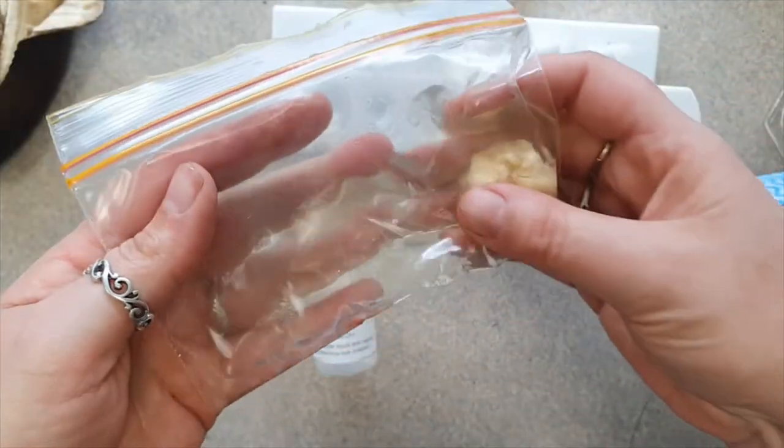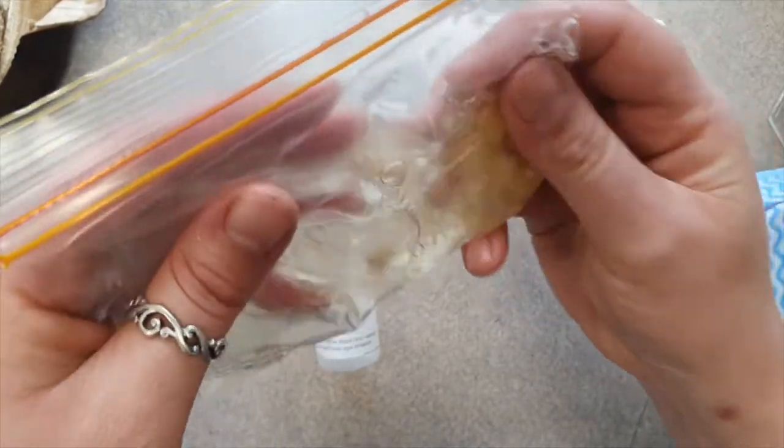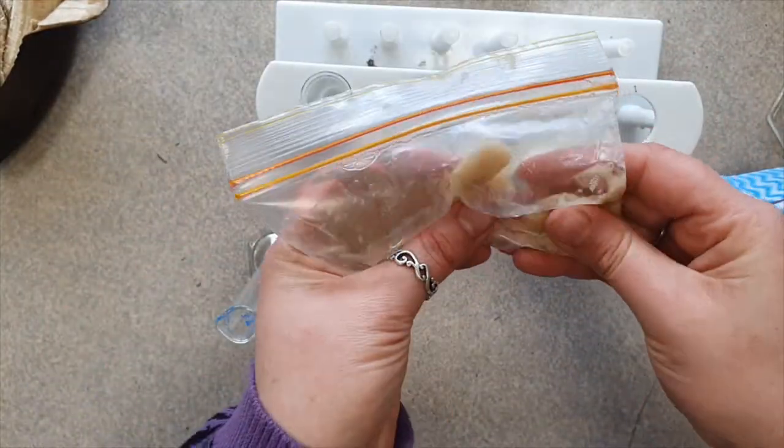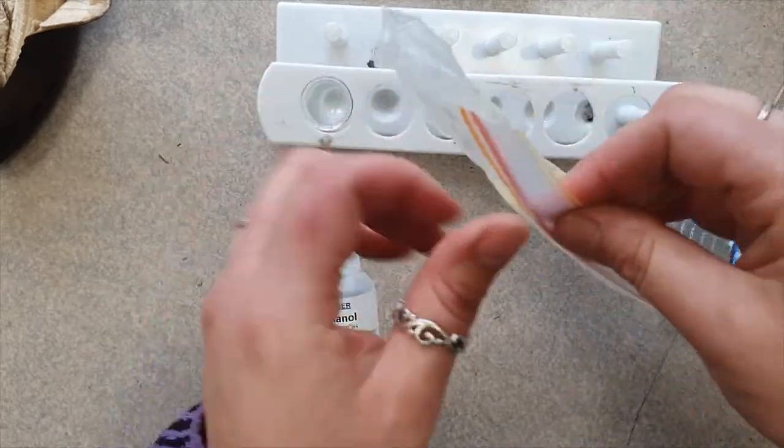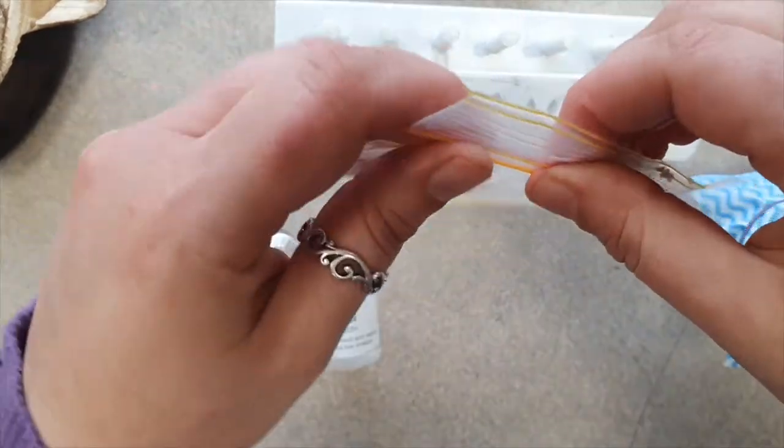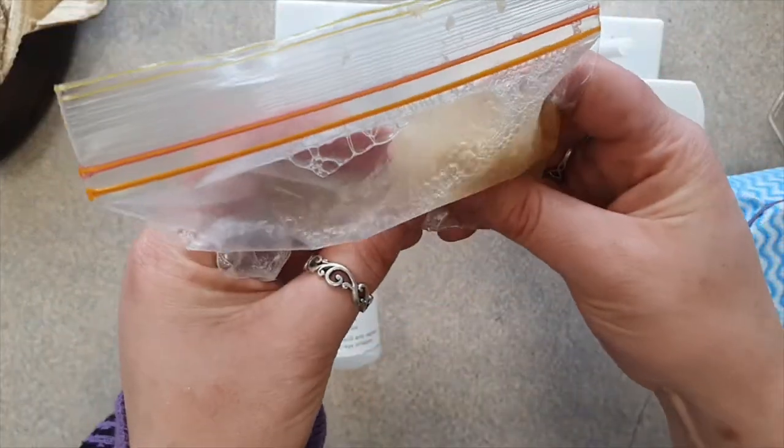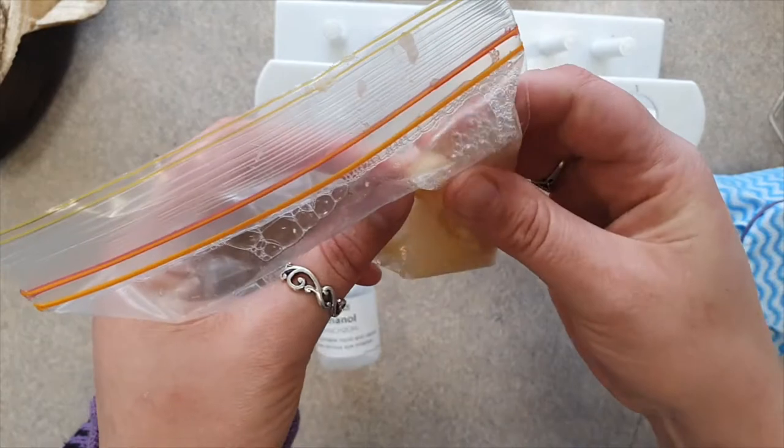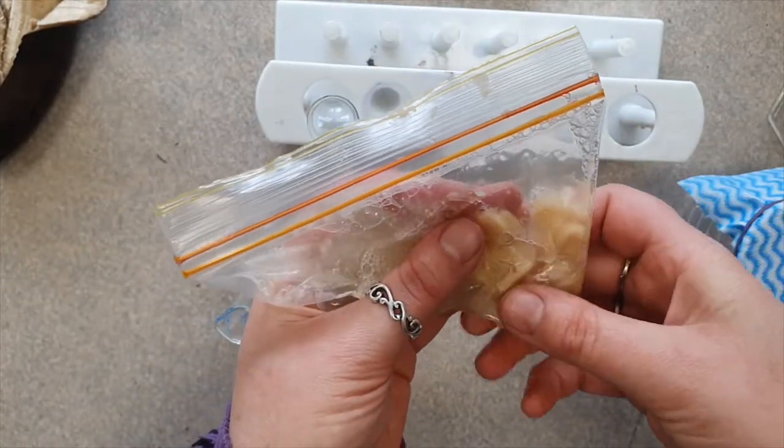There you go. Look at that. So the banana is sitting in there and then I'm literally just going to squish it. This is probably the funnest part of the prac. Squishing the banana. So right now I'm going to let some air out. I'm just breaking up the banana so that this DNA extracting solution can have better access to the cells.